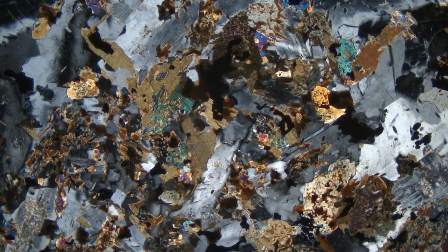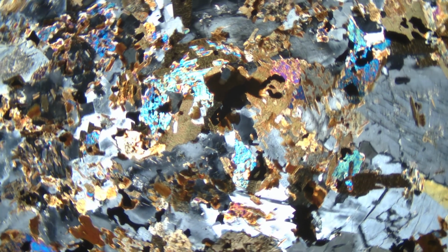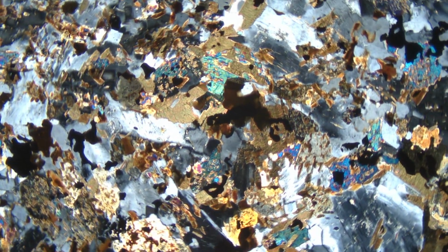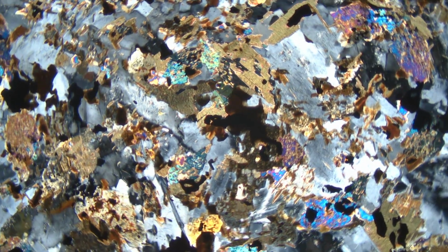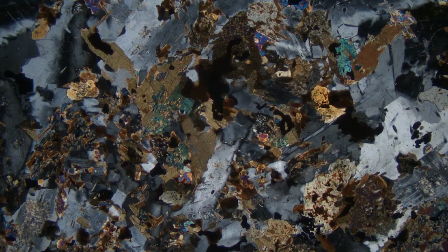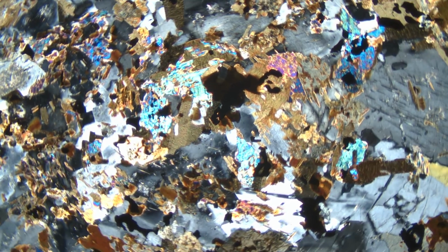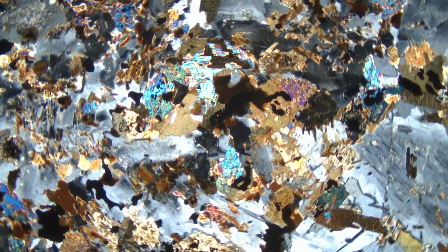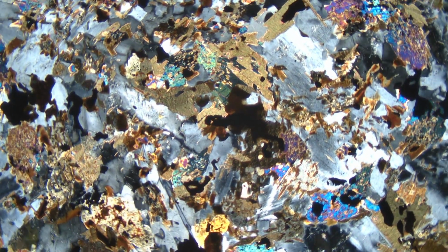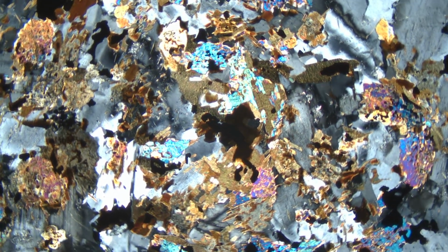The grains that were clear in plane polarized light now show white to gray to black interference colors. Some of them show stripes, which are twinning, which tells us they are plagioclase feldspar. And other grains show what is called undulatory extinction. They go black at different times in different parts of the grain, which means they are quartz. So by examining this thin section in both plane polarized and cross-polarized light, we can identify all the minerals that are present, even if the grains are so small that we couldn't see them in hand specimen or with a hand lens.